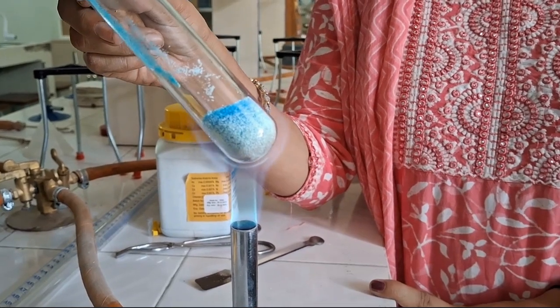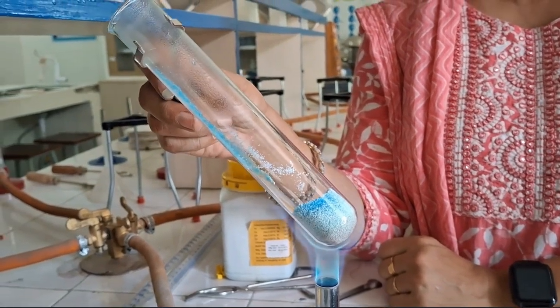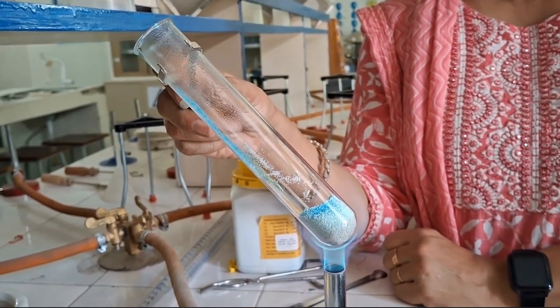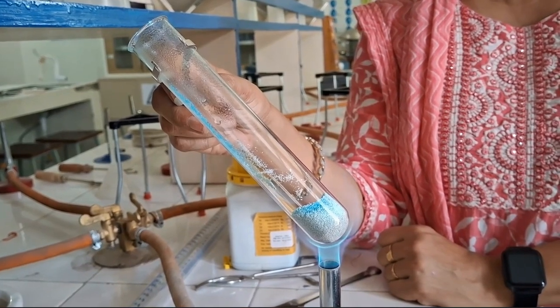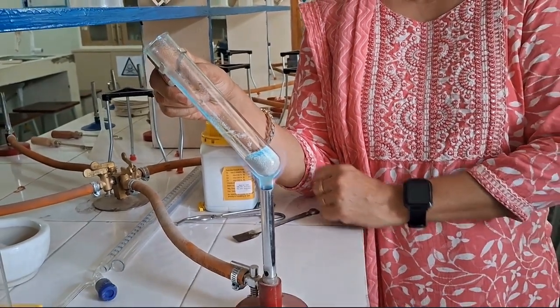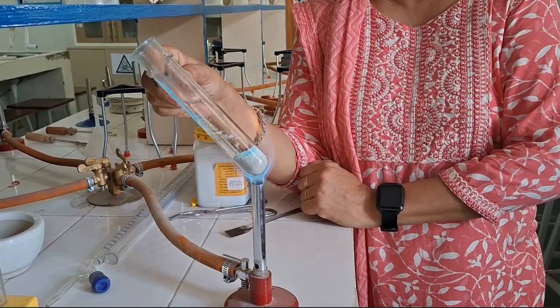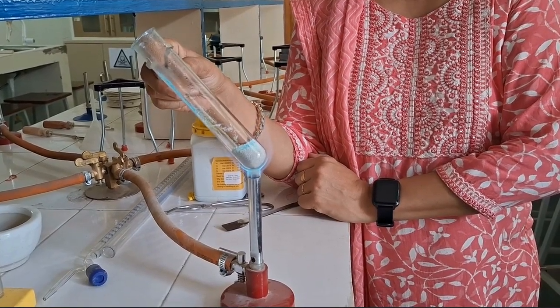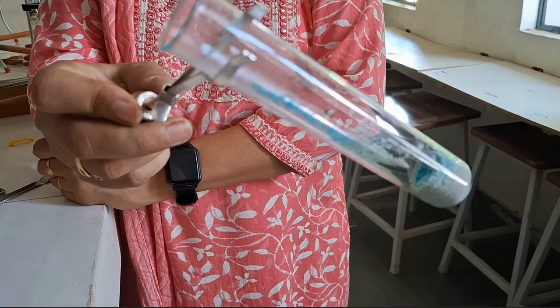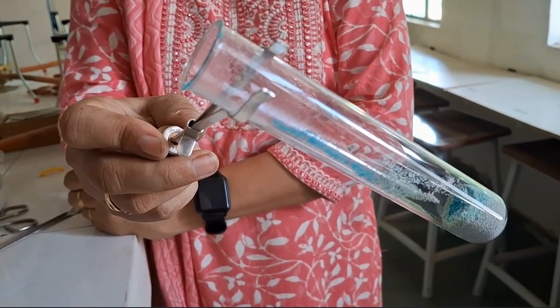And at the mouth of the test tube, if you see closely, you can see some water droplets here. It is the water that is escaping out from the crystals of copper sulfate because copper sulfate has 5 molecules of water of crystallization associated with it. When we heat it, these water molecules escape, forming a condensate inside the test tube near the mouth of the test tube because that is the part which is comparatively at a lower temperature. And the crystals have turned white. Look at it carefully, you can see the water droplets inside the test tube. So this is an example of a thermal decomposition reaction.